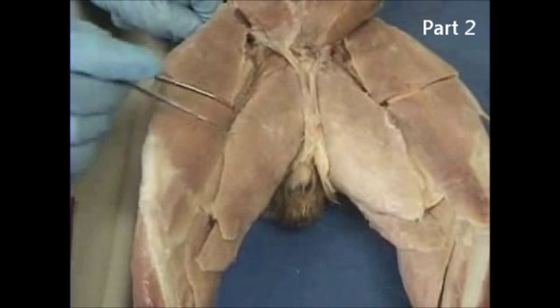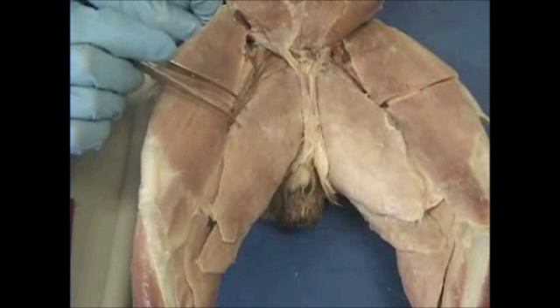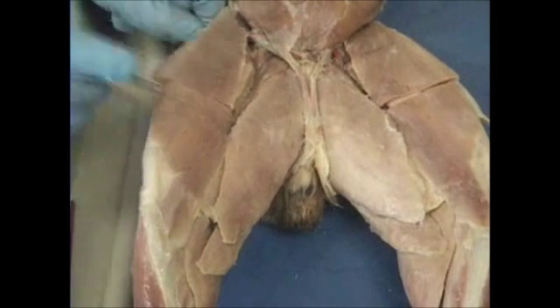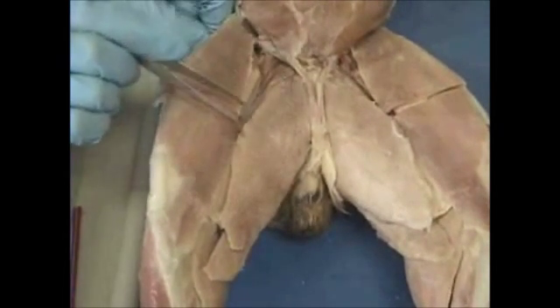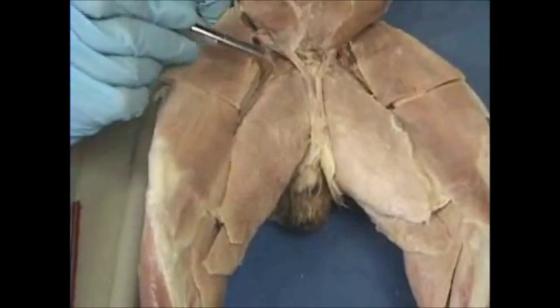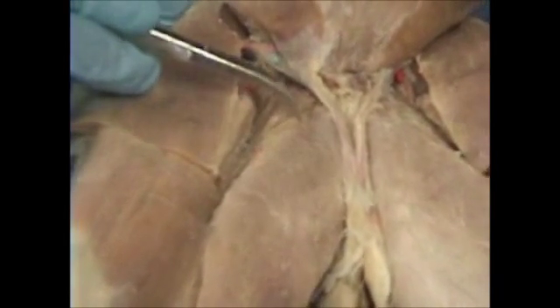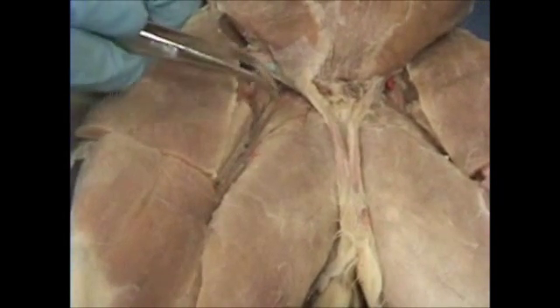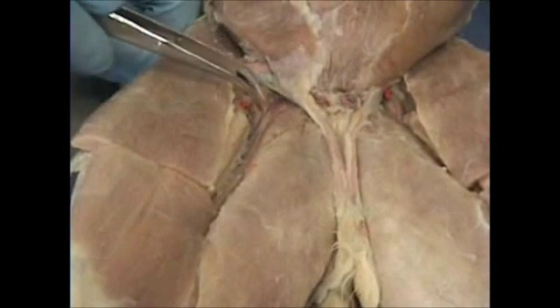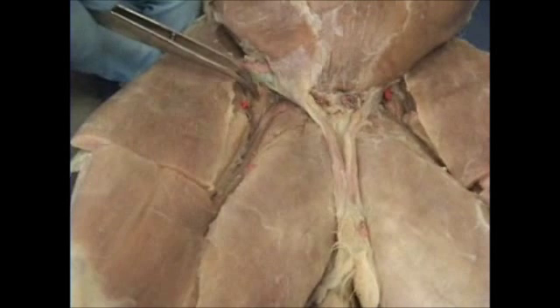Just in case you don't see your gracilis retracted backwards, you still can see the underlying muscles in view. Here we have our gracilis, a superficial muscle. Above the gracilis you see a tiny bit of your adductor femoris, adductor longus, pectineus, and iliopsoas.